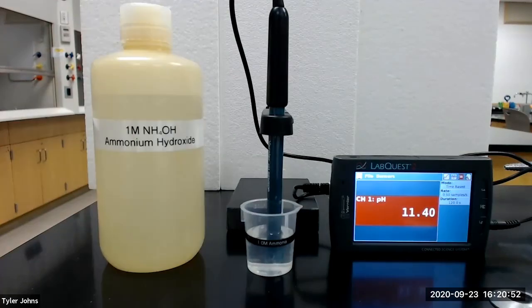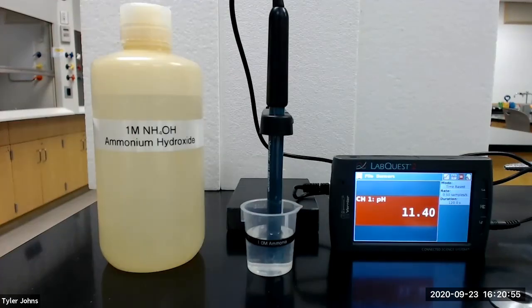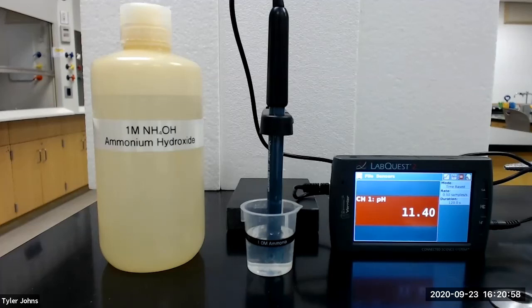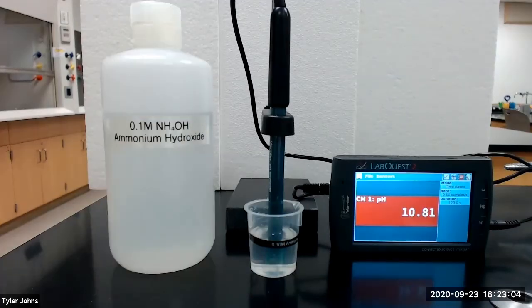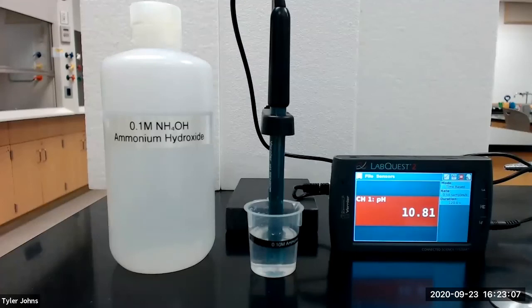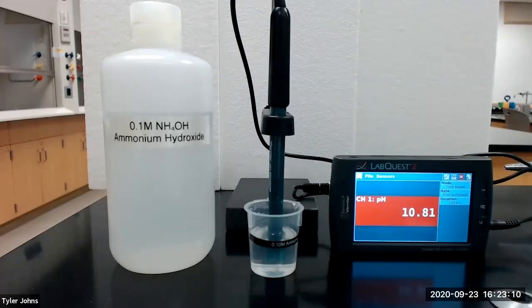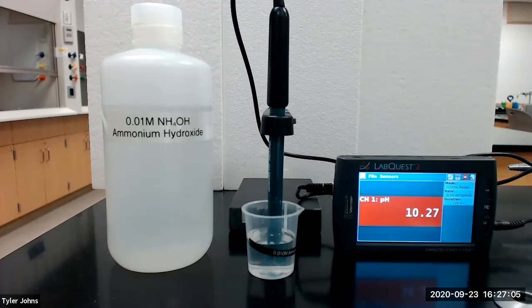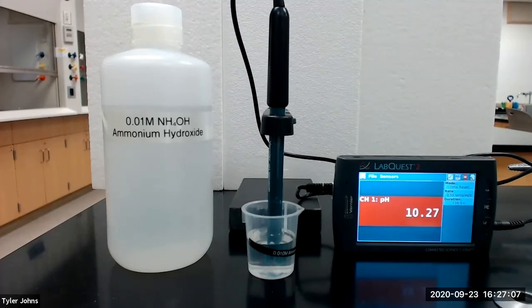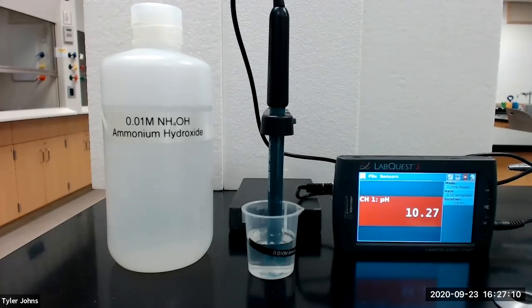Our next solution is 1.0 molar ammonium hydroxide, which has a pH of 11.40. Our next solution is 0.1 molar ammonium hydroxide, which has a pH of 10.81. Our last solution is 0.01 molar ammonium hydroxide, which has a pH of 10.27.